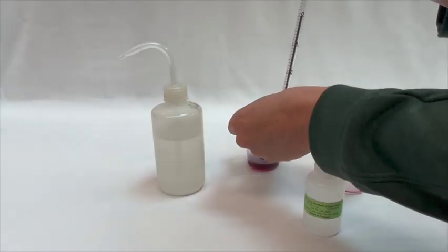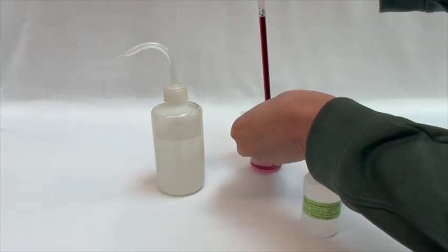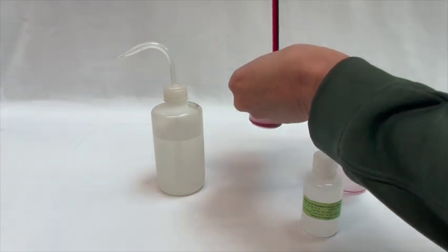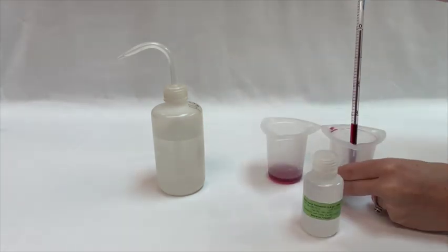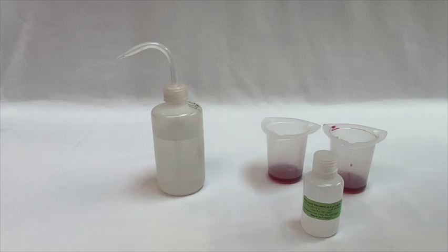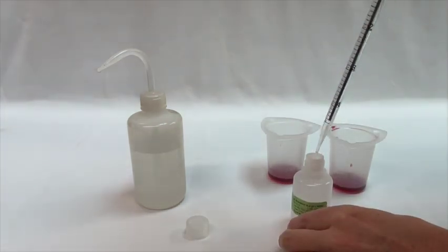Using either your 5 ml or 10 ml sampling pipette, transfer 5 ml of the boiled wine sample into a beaker. If you are testing multiple wines, make sure you rinse the pipette between wine samples. And mix it with 5 ml of the 0.0 g per liter standard.